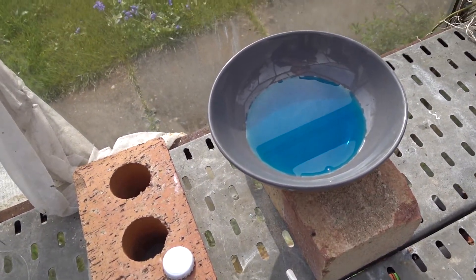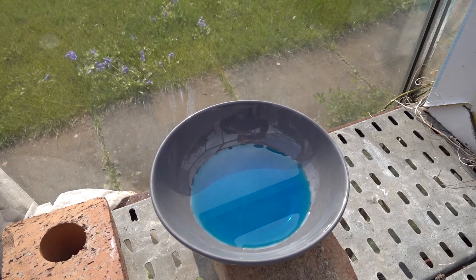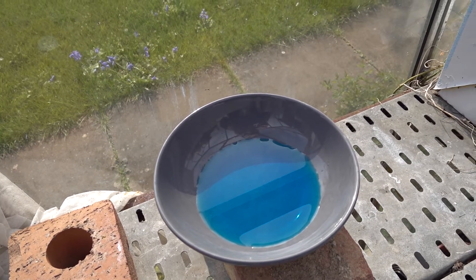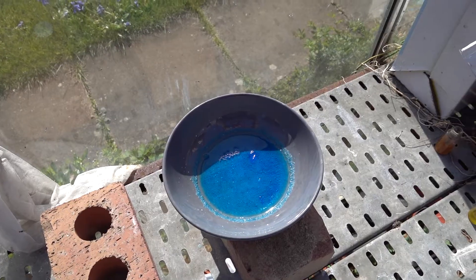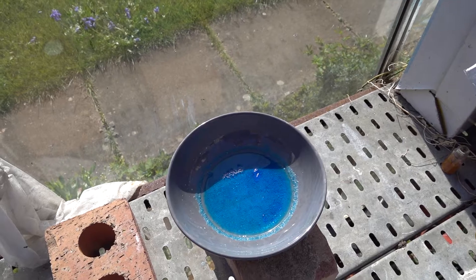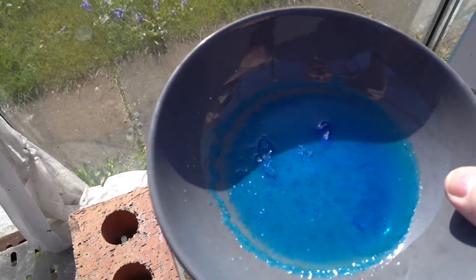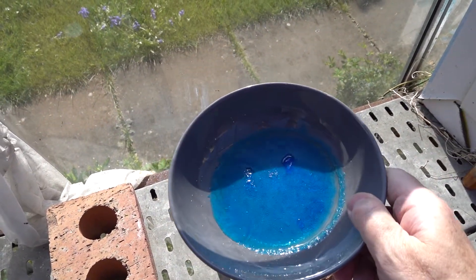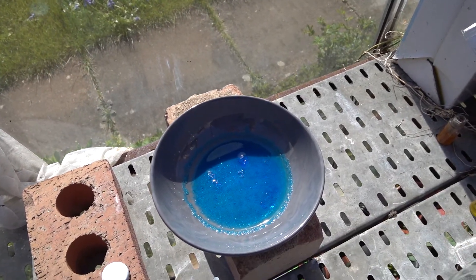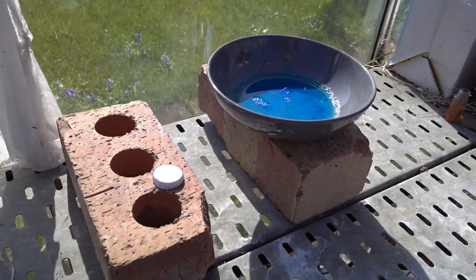You can see a clean solution at the start. Here are the crystals of copper sulfate after the solution has been left to crystallize overnight. I did seed it by adding a small crystal to see if we could get a larger one, and we have in fact got that. What we now need to do is filter the mixture so that we can get the solid crystals out.